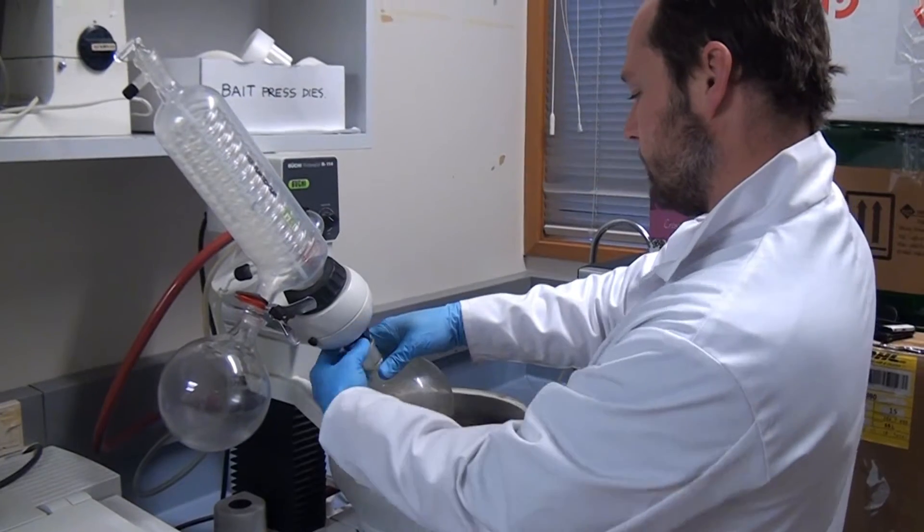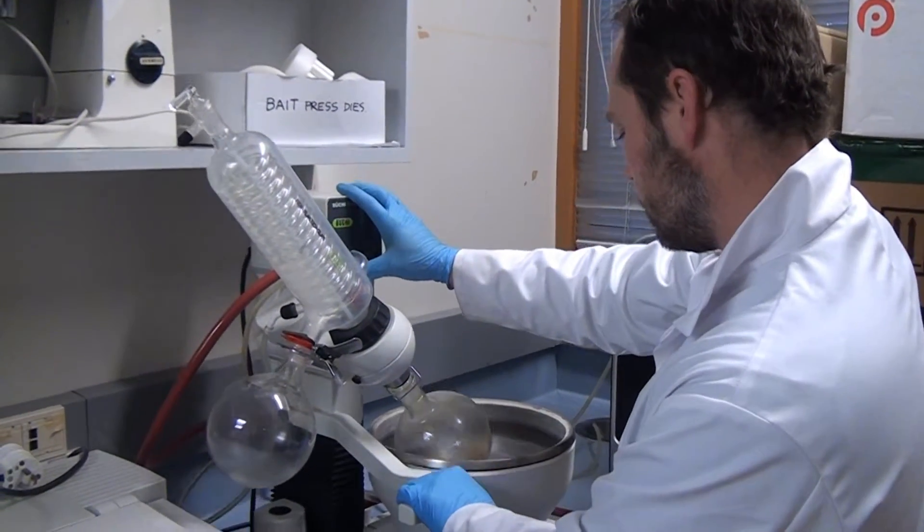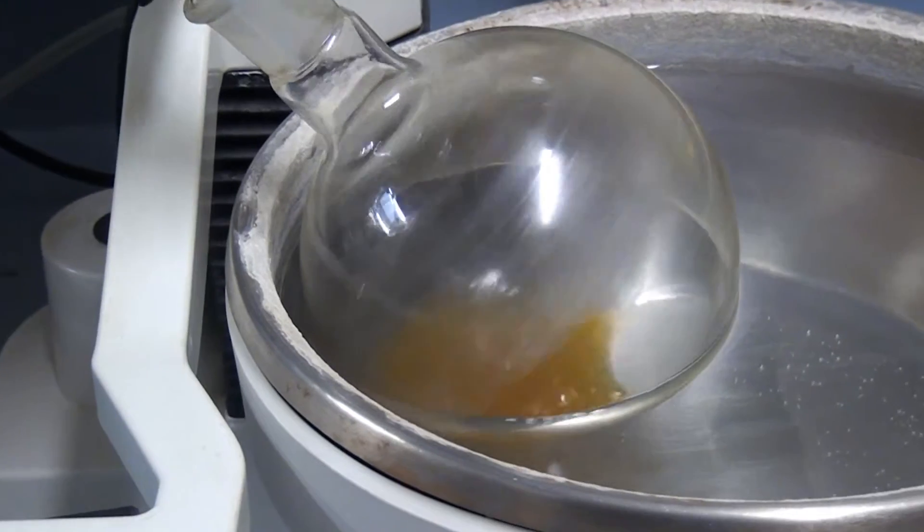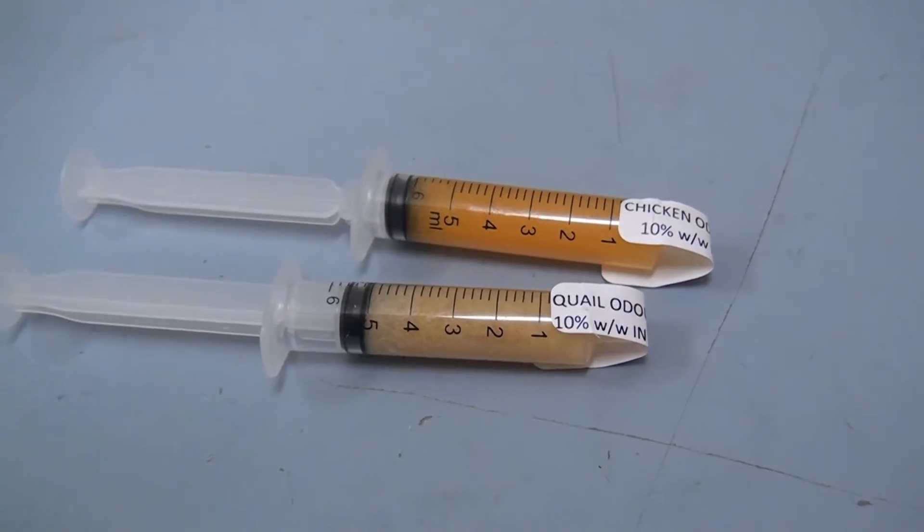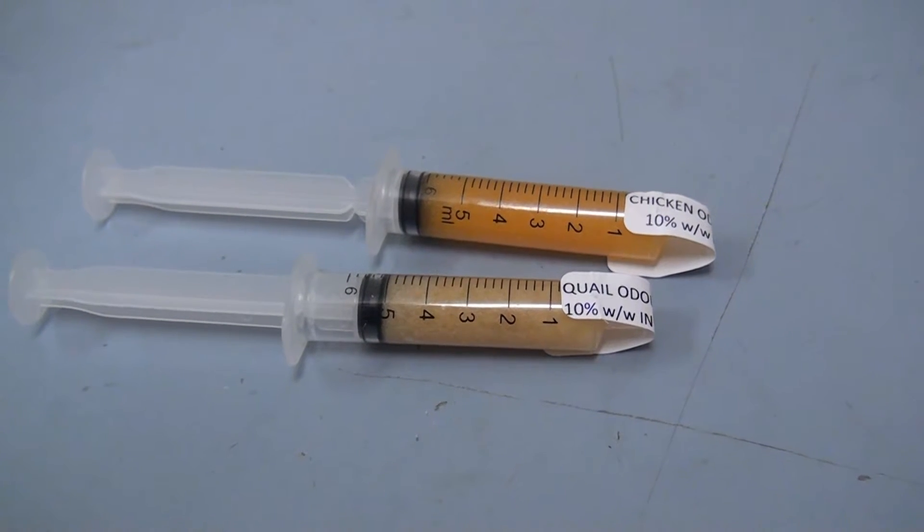And then decant the solvent off and remove the solvent by rotary evaporation to concentrate the odour extract down, and then I mix it up in Vaseline which is quite neutral and I use that to carry the odour.